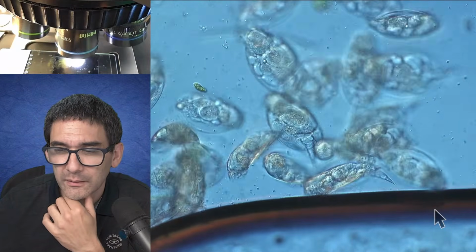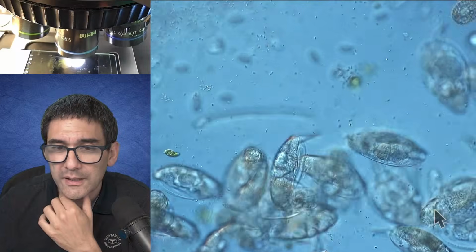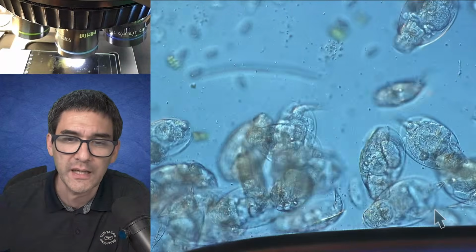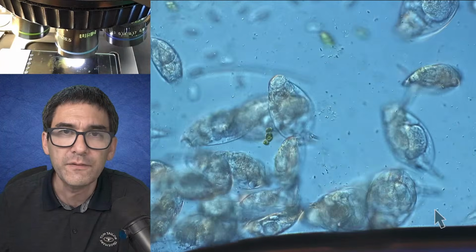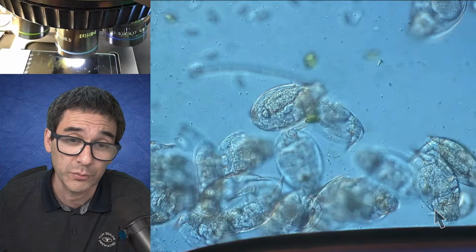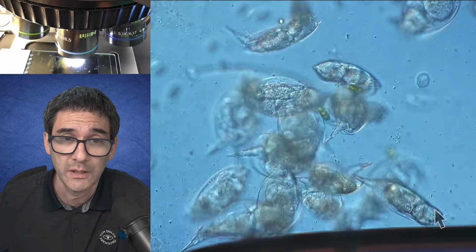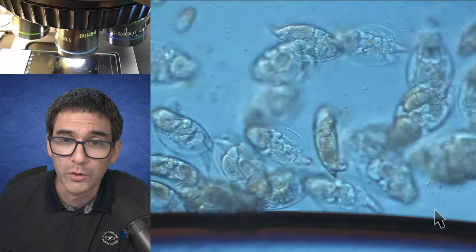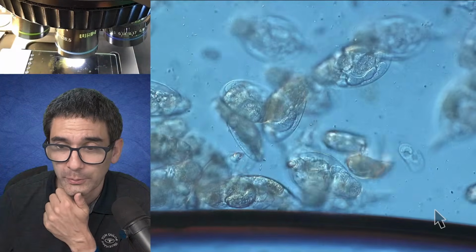Yes, that's another thing here. I use Google Photos. Generally, that's something I recommend in any case, that you can significantly improve your image, and maybe the biggest improvement is you just do a contrast improvement of whatever micrograph you've got. If you do a contrast improvement, then subjectively the image will also appear more crisp and sharp.